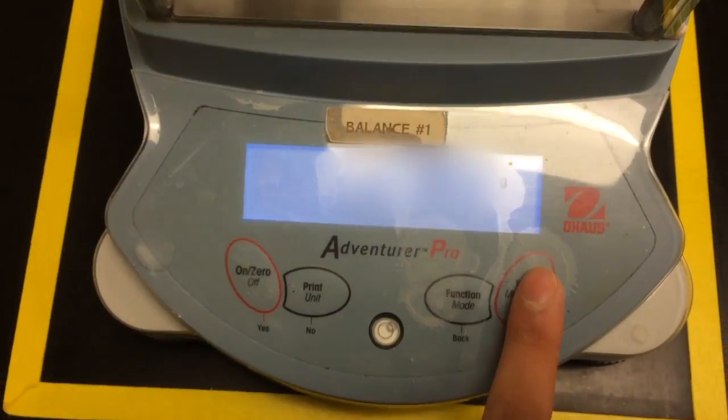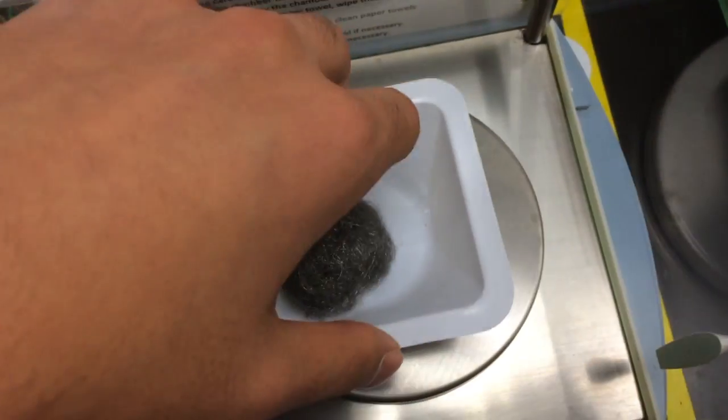Next, we're going to take the mass of our steel wool ball. You're going to want to take the mass and record that for your post-lab calculations later on.